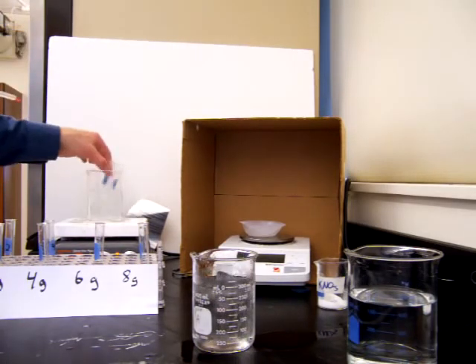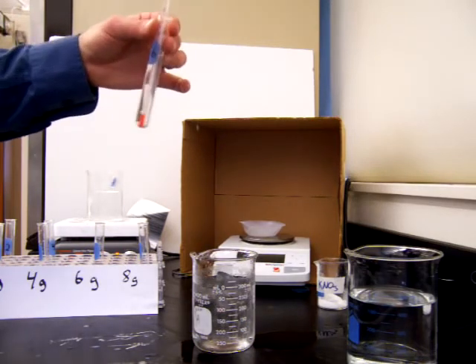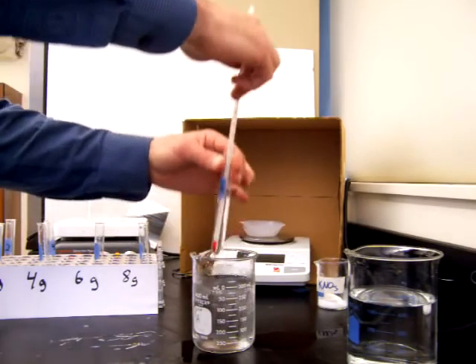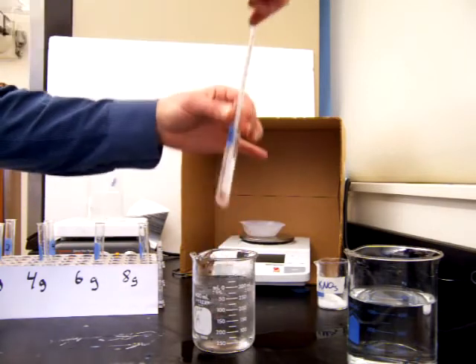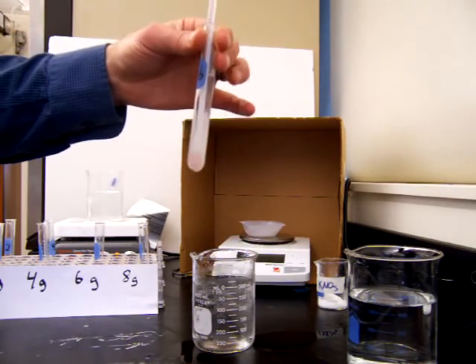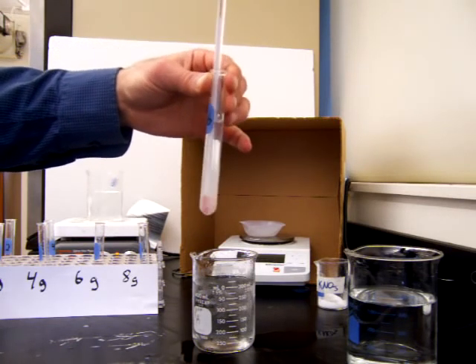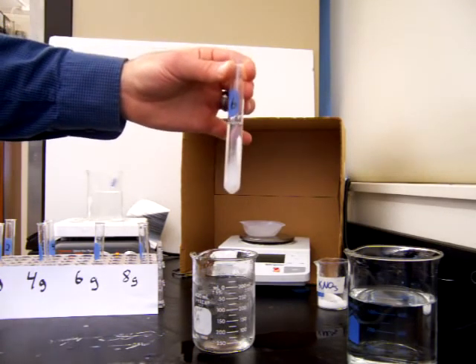Okay, we have 2 more to go. We have the solution that contains 6 grams of salt dissolved in 5 milliliters of water. So we'll cool this one off. This one will go a little faster than the last 2 if the trend continues. So we're stirring this, and we already see some crystals forming there at the bottom. We just want to get it when the first crystals start to form, and that occurred at 66 degrees Celsius. So at 66 degrees, we started to get crystals out of the 6 grams of potassium nitrate solution.